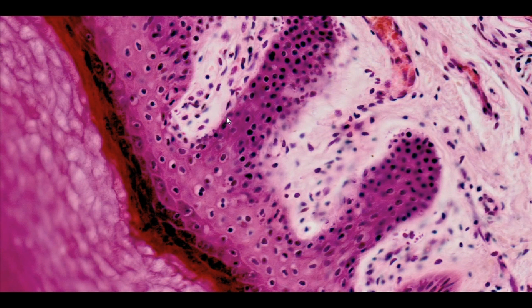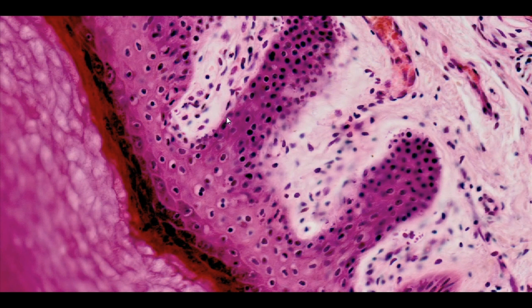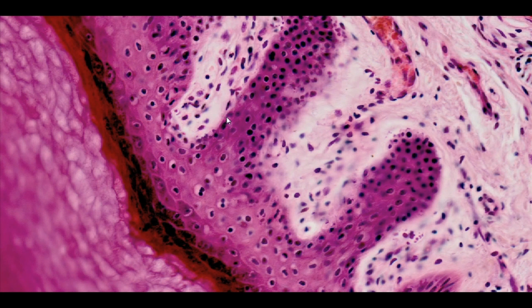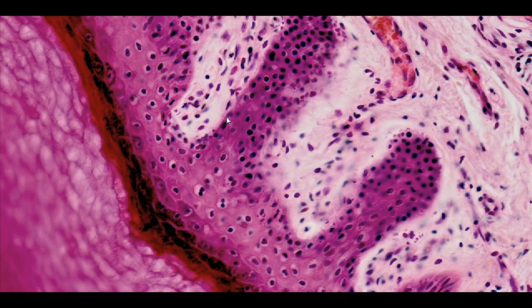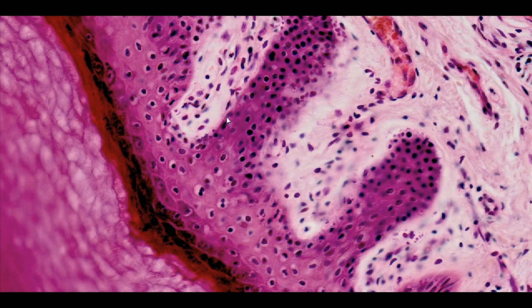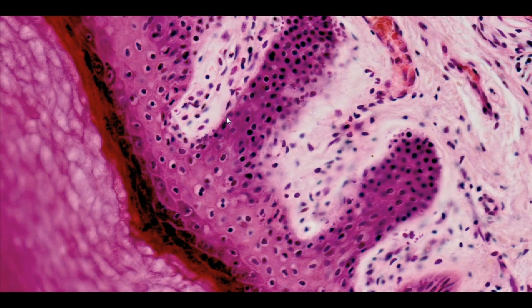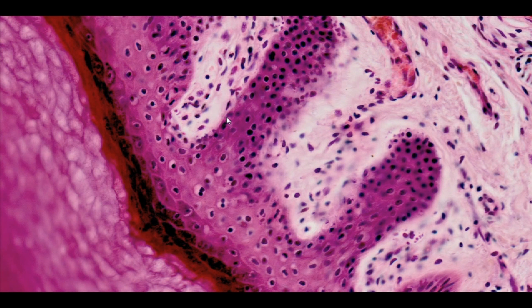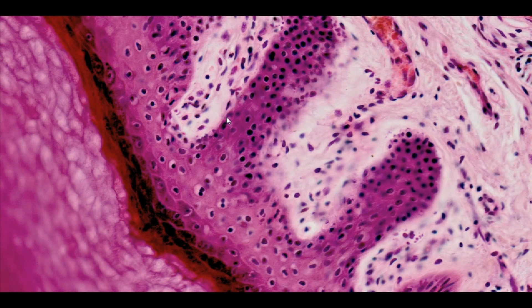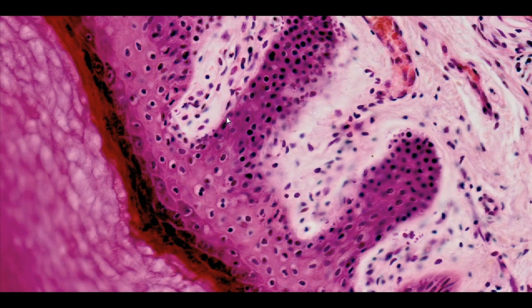Among the stem cells in this layer, there are also melanocytes, responsible for the production of pigment, and Merkel cells, which form sensory bodies with nerve endings reaching the epidermis. However, H&E staining does not allow for their identification.